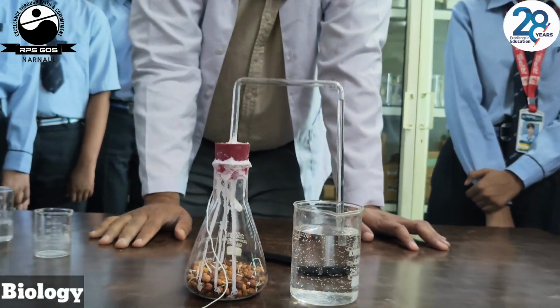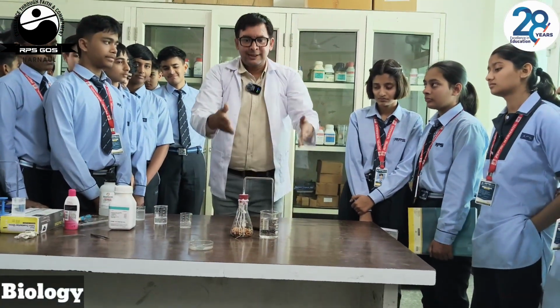This shows that CO2 is given out during respiration. This was our final result.